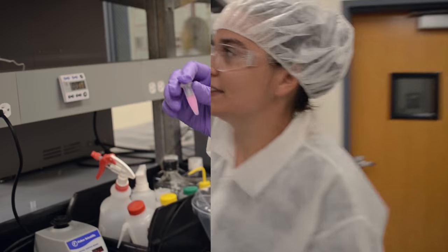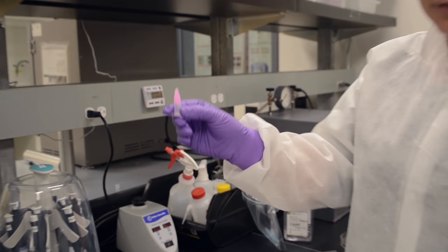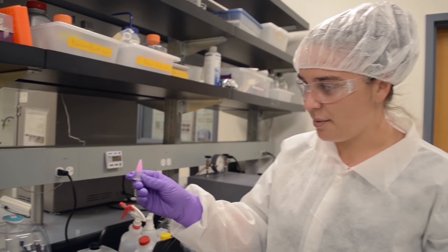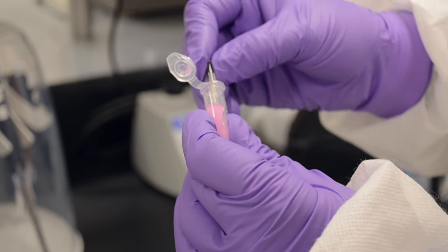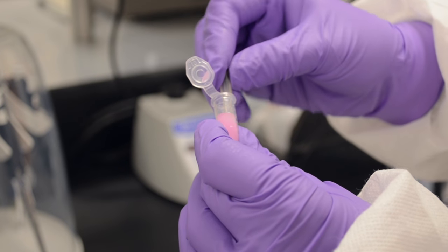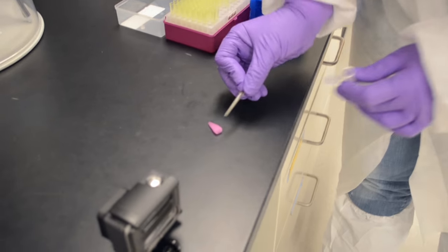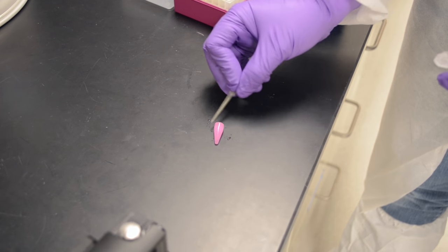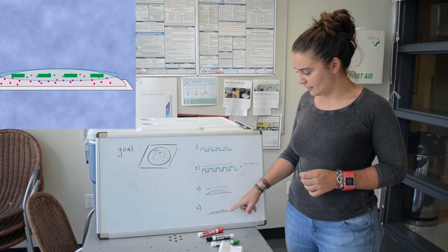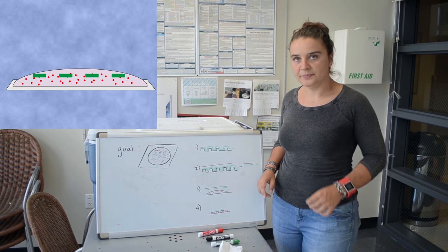Okay. And then in 5 minutes, can we check it and see that it's not liquid? So it's been around 5 minutes and you can see that the gel has solidified. It's become a solid, not a liquid anymore. You can even see that it took on the shape of its container. Oh, there you go. It's like flubber. Whoa. It's totally like flubber. And at the end, we'll be left with a gel and protein patterns on top.